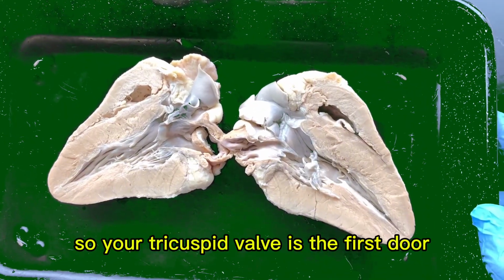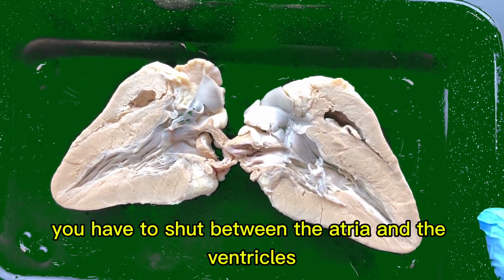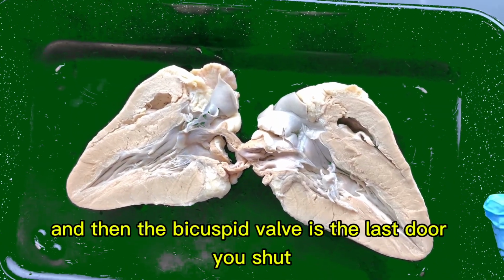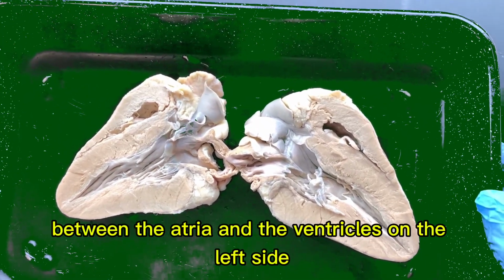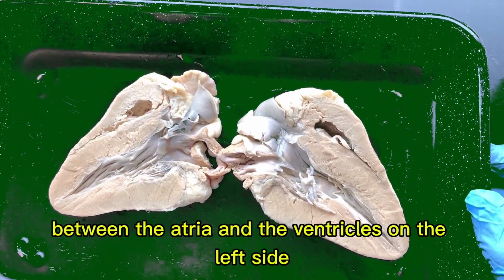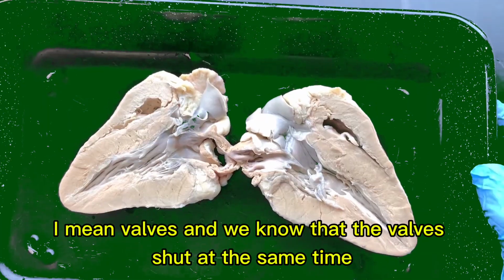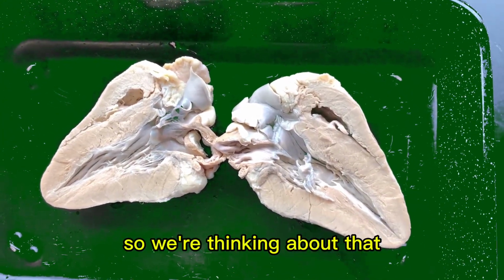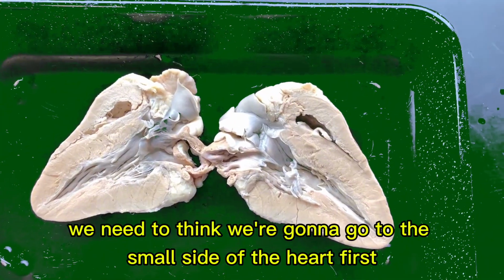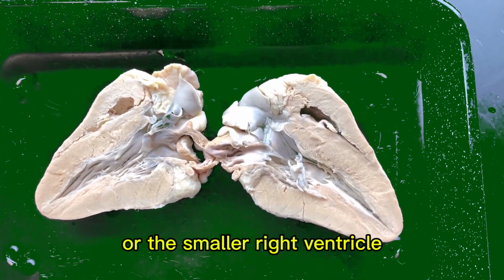So your tricuspid valve is the first door you have to shut between the atria and the ventricles, and then the bicuspid valve is the last door you shut between the atria and the ventricles on the left side. Now by doors, of course, I mean valves, and we know that the valves shut at the same time, but we're just tracing the path of blood through the heart. So if we're thinking about that, we need to think we're going to go to the small side of the heart first, or the smaller right ventricle.